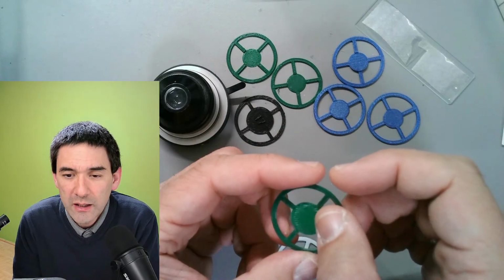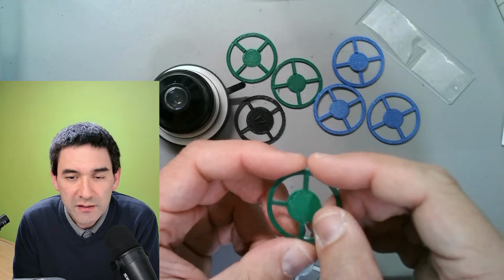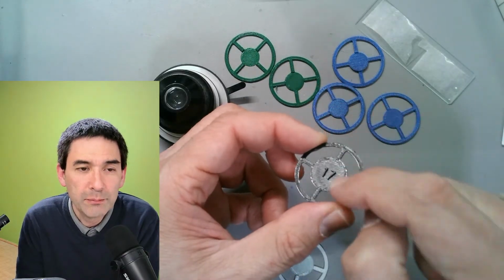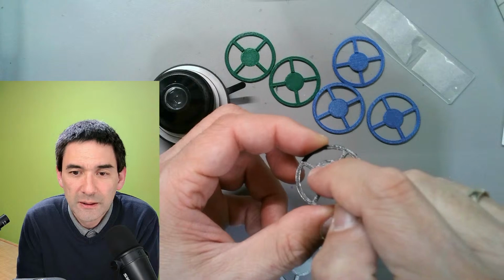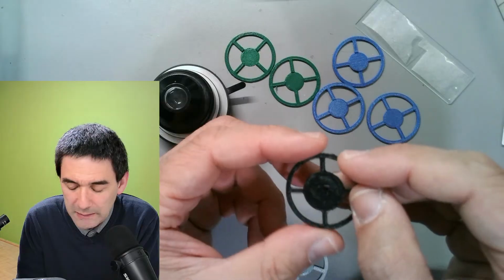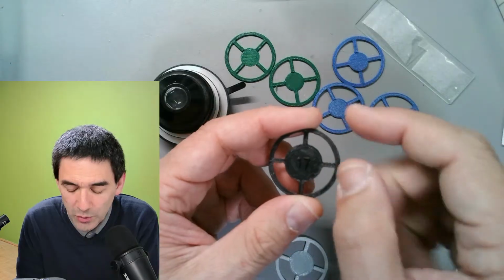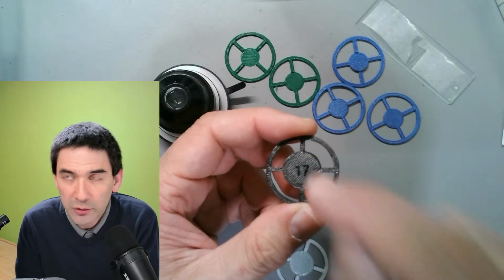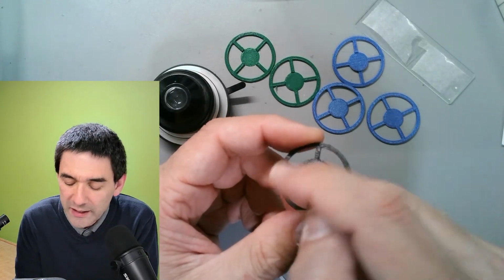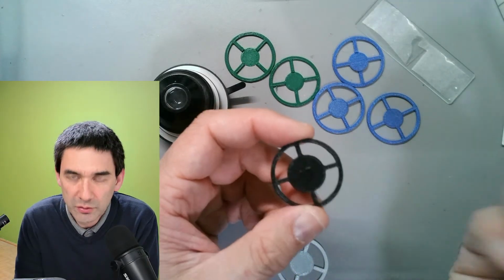So let me quickly check the time that we have. Okay, 17.5 millimeter, yes. For example, this one over here is 17 millimeters. It's 3D printed. What I've done is I made these filters, which are printed in just a couple of minutes. I made a whole series going from 10, 11, 12, 13, 14, 15, 16, 17 and so on. Generally what you do is you try the different ones, and then you throw away those that don't give you the results that you want.